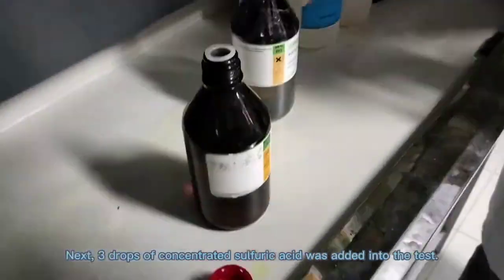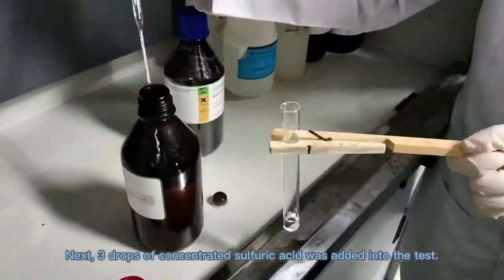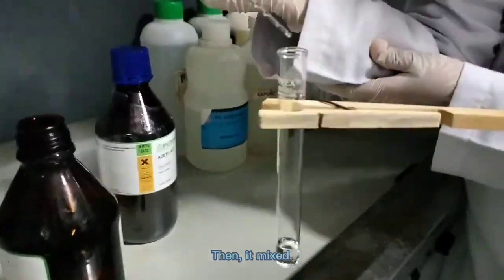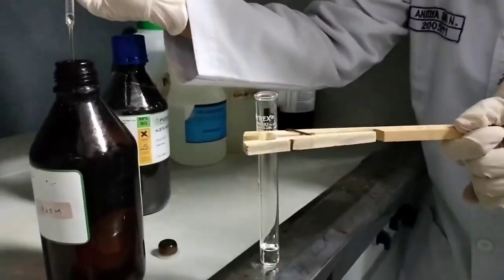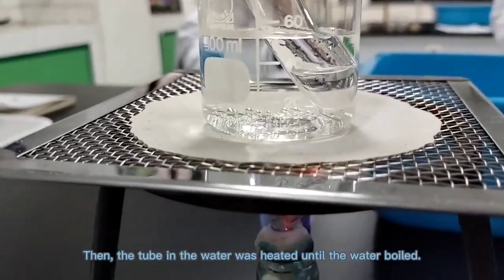Next, 3 drops of concentrated sulfuric acid was added into the test tube, then it mixed. Then, the tube in water was heated until the water boiled.